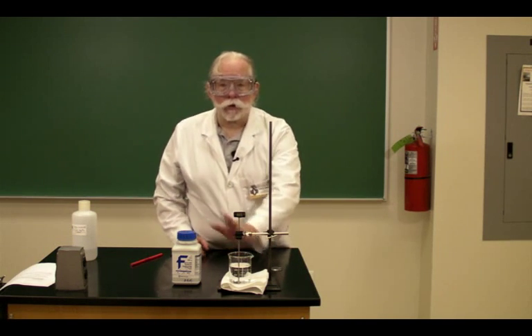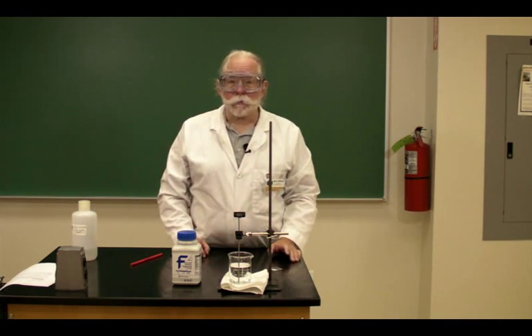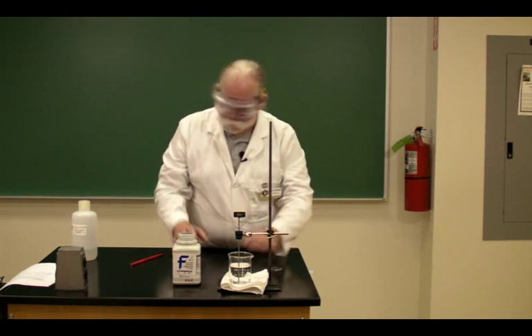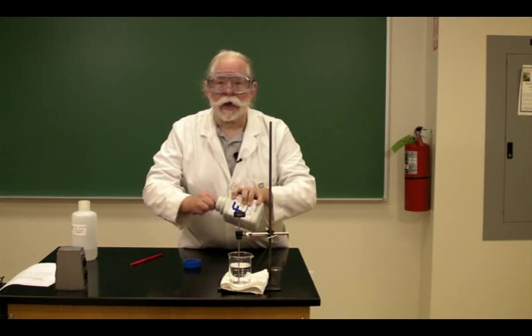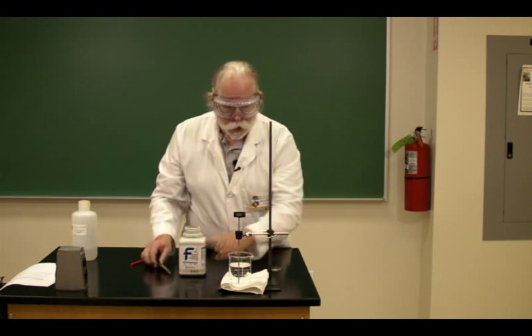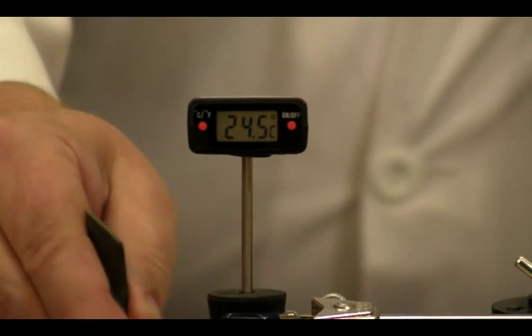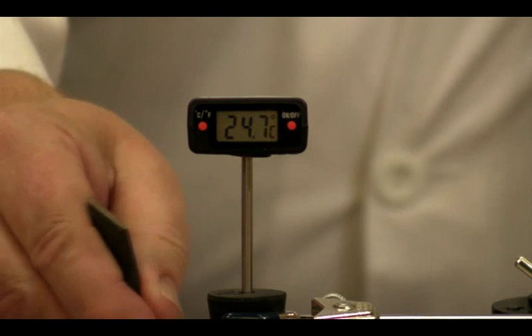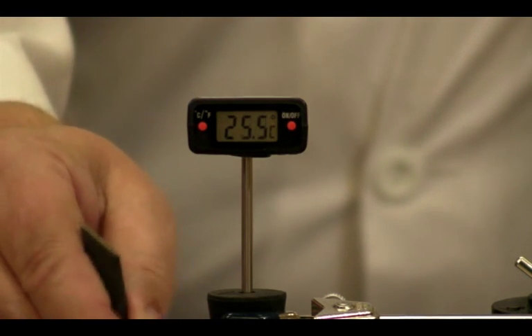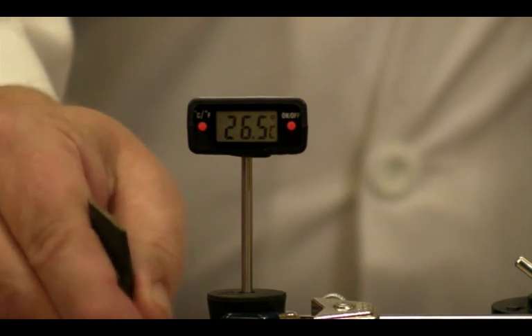For instance, here's some water and a container of sodium hydroxide both at room temperature. I'm going to take some solid sodium hydroxide, add it to the water, and stir. What happens to the temperature? The temperature increases, so the water has been heated by the chemical reaction of the sodium hydroxide crystals dissolving in the water.